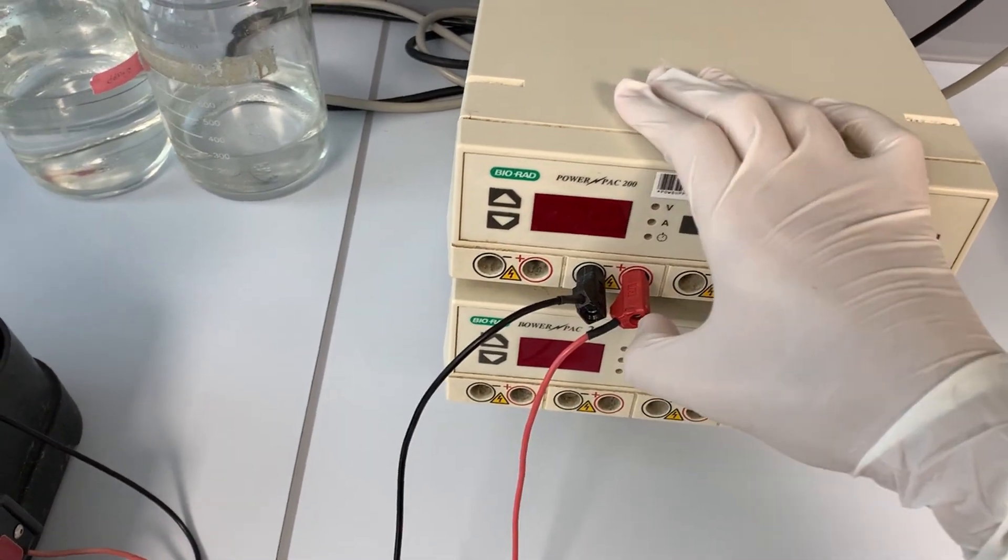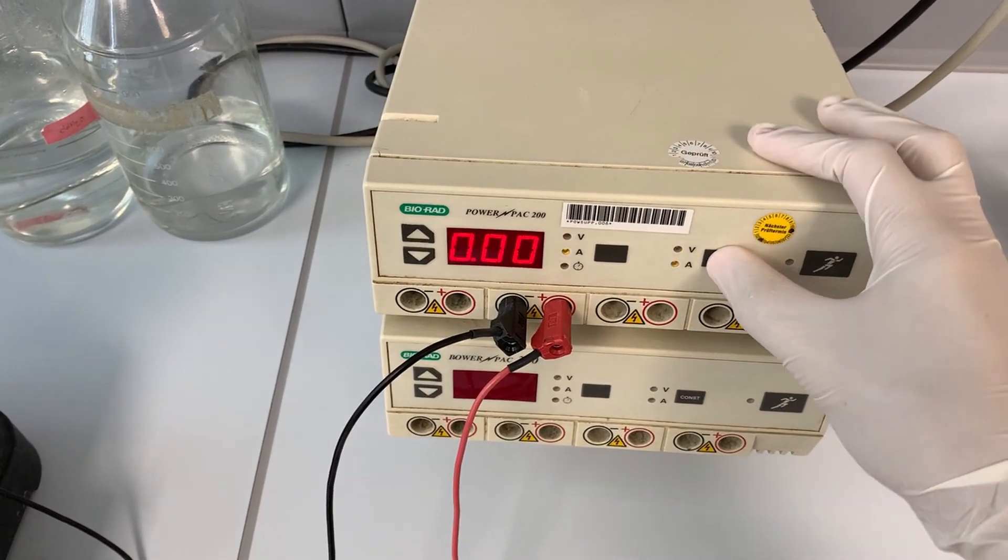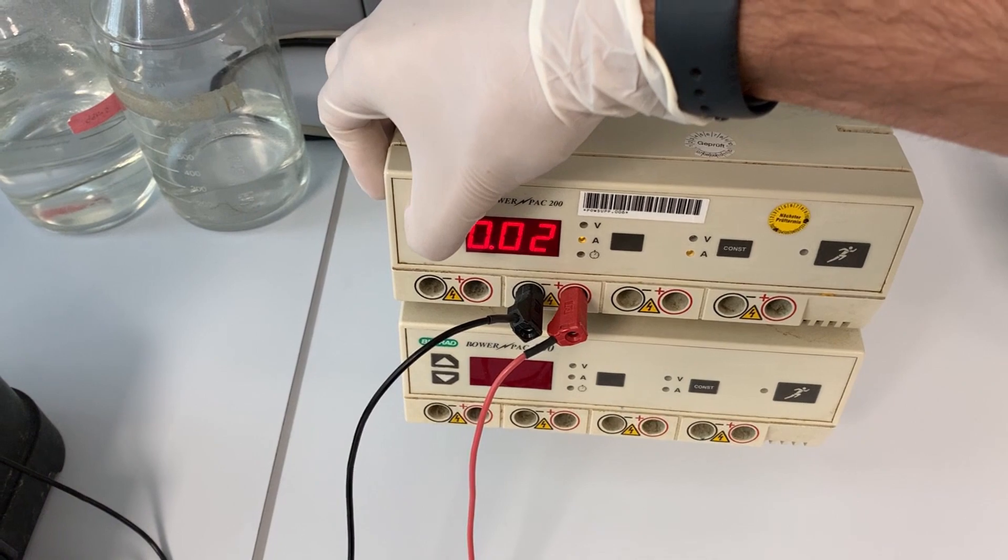I connect the cables to the power supply and adjust it to constant ampere. I calculated for my experiment 0.07 ampere per blot. I run the transfer for 90 minutes.